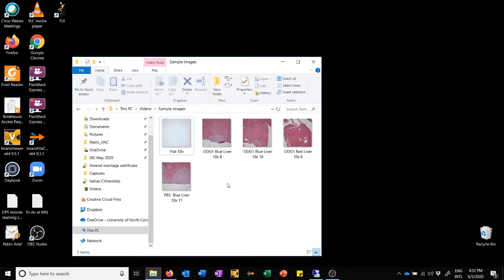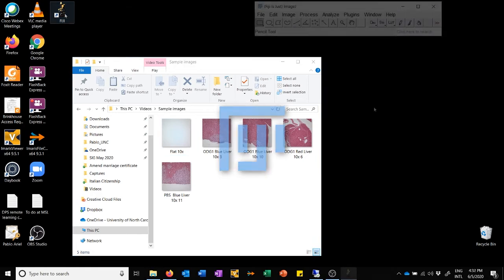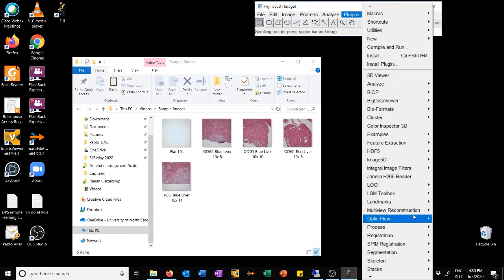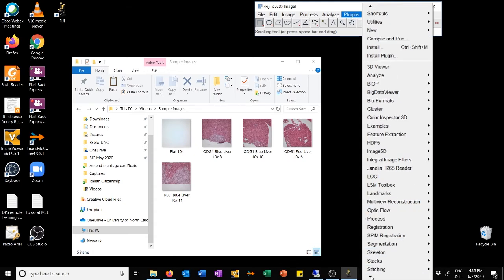So let's look at how we can use the macros provided by the MSL to improve these images. First we need to open Fiji. Okay, so once Fiji is open, we can process these images by using a plugin that is in the plugin menu of Fiji, and I've placed it in a submenu called MSL.